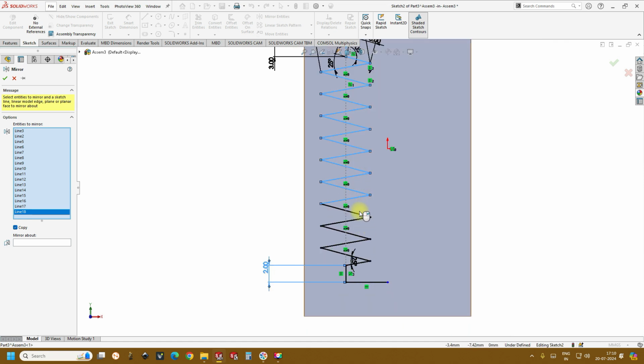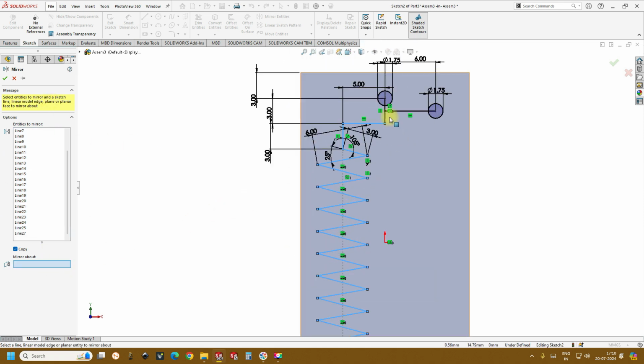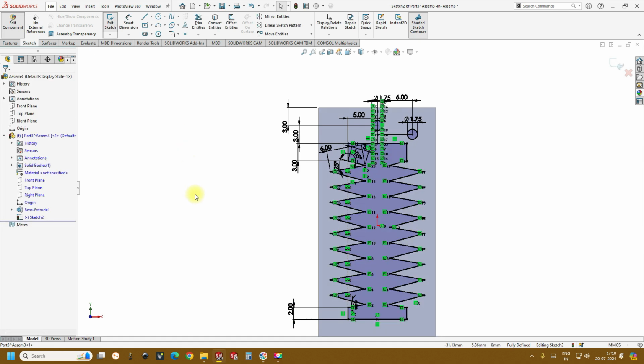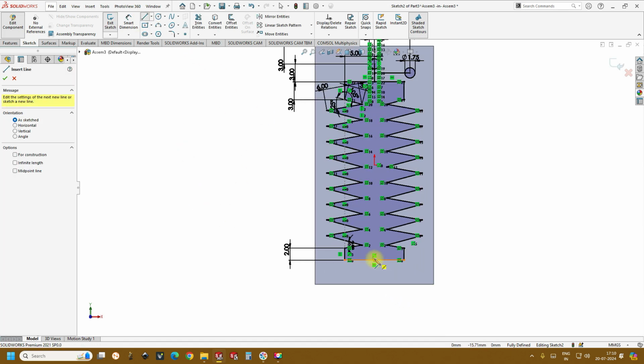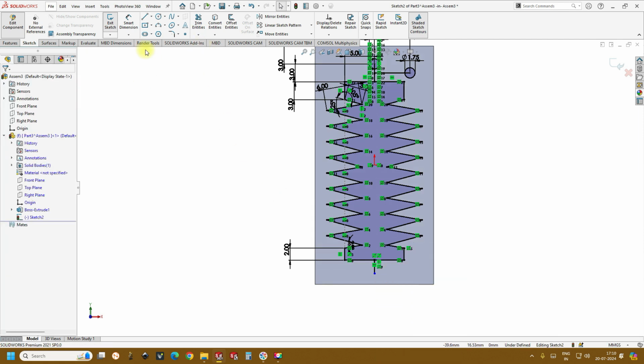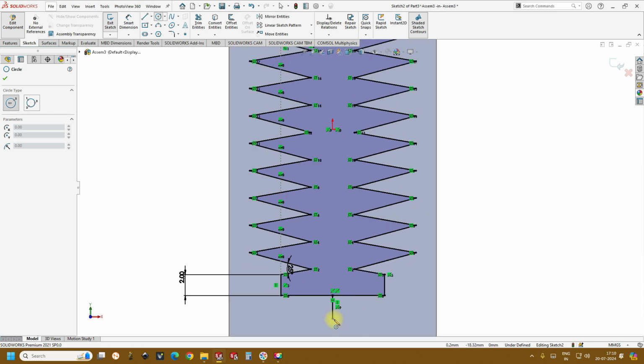Just keep selecting. This. And then this is asking about mirror about what? Mirror about the center line, so that we can see this happening on the right hand. Just click OK. So this is ready. And then what we need from center is an outlet. And similarly, one outlet over here.